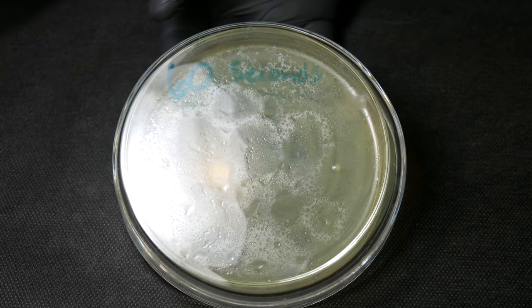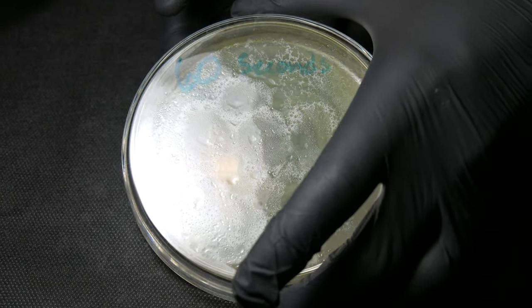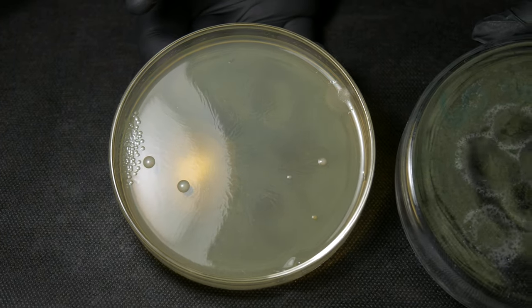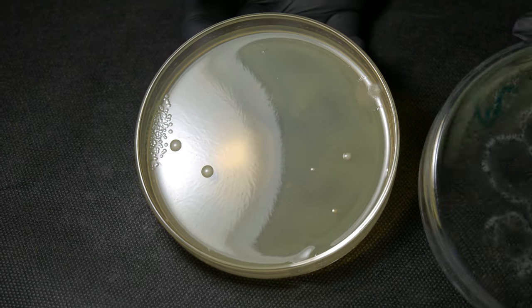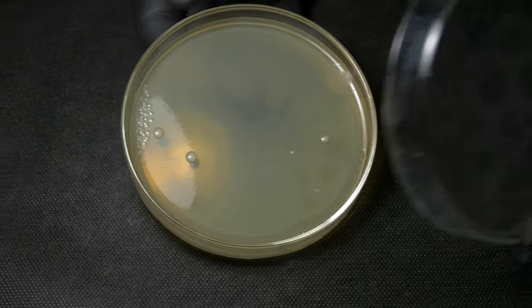Here is the plate after boiling the pond water for 60 seconds. You can still see really great bacterial colonies forming here of all different morphologies. You can even see a really great example of a fungal colony forming in the top right. Of course, you would want to suspect that even after boiling water for 60 seconds, as the EPA says, you shouldn't see any bacterial growth at all on any of these plates.